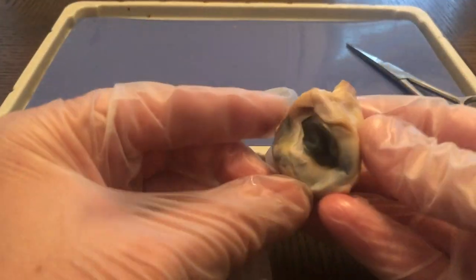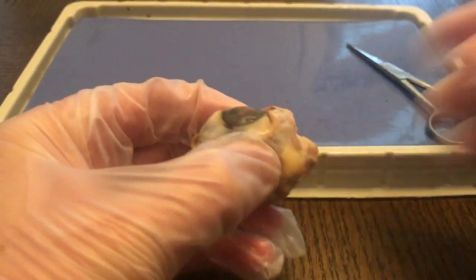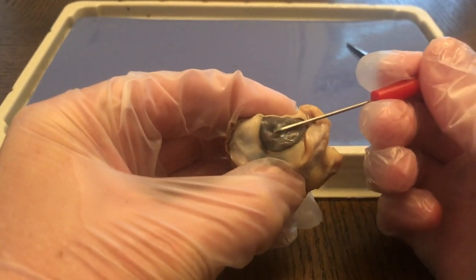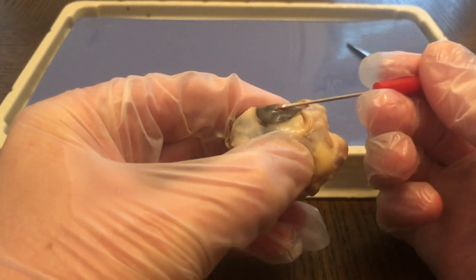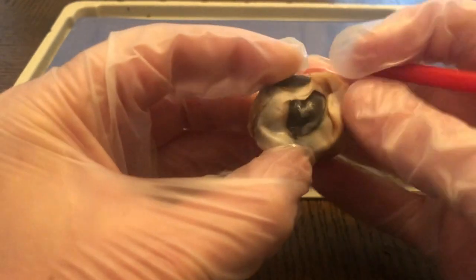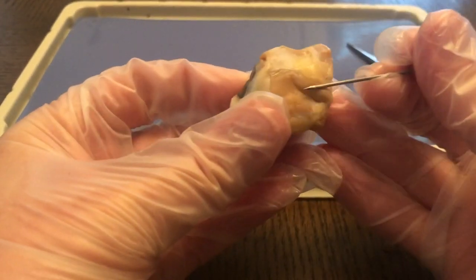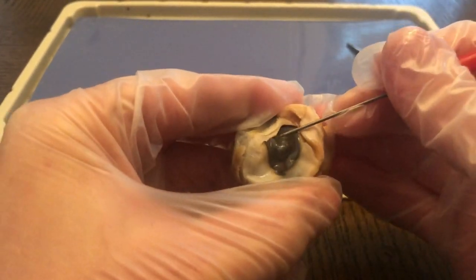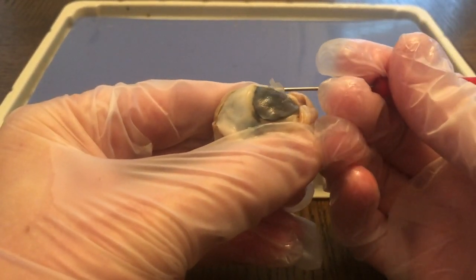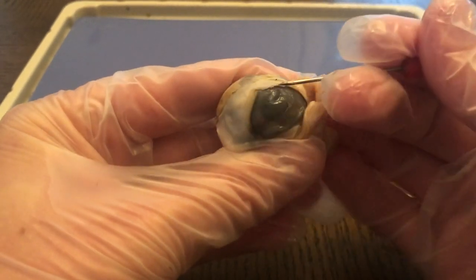This is a cow eye, and you can actually see the cornea of the eye. And we're going to remove the cornea. You can see that leathery structure here, and you can see the white of the eye, and we can see a lot of the muscle here as the muscle allows the eye to turn left and right. Okay, now there's not just muscle on the outside, but there's muscle on the inside, and that would be the iris. Now, the cornea is very thick, protects the eye, and basically protects it from UV light.